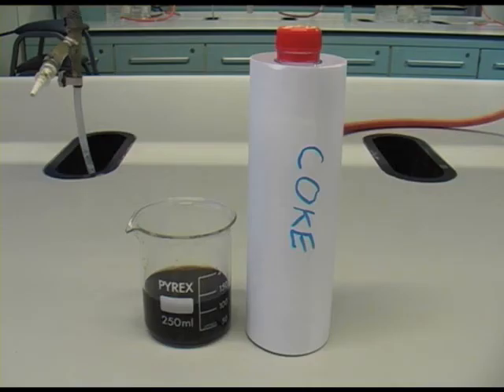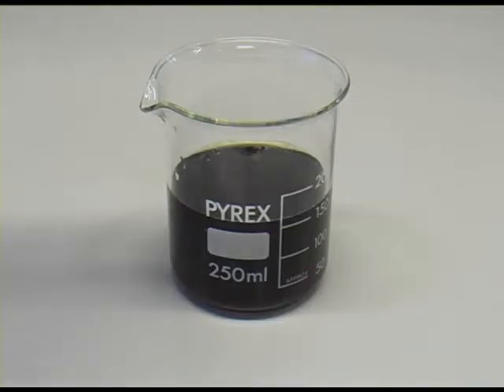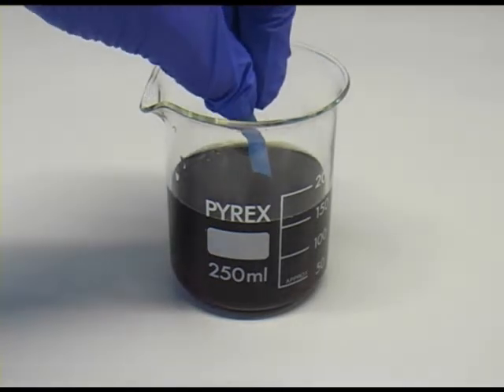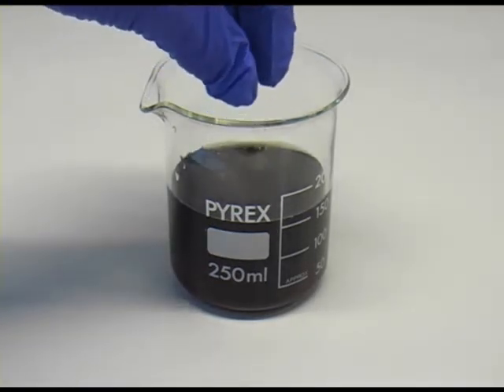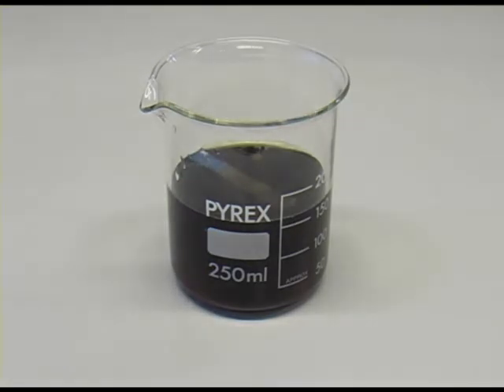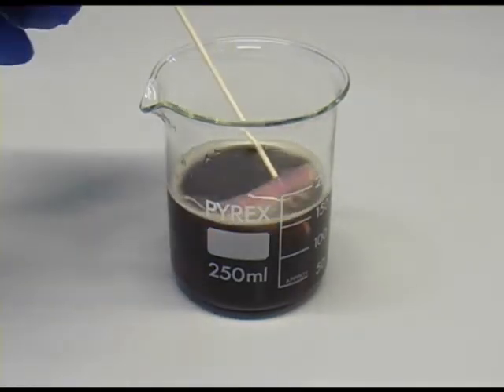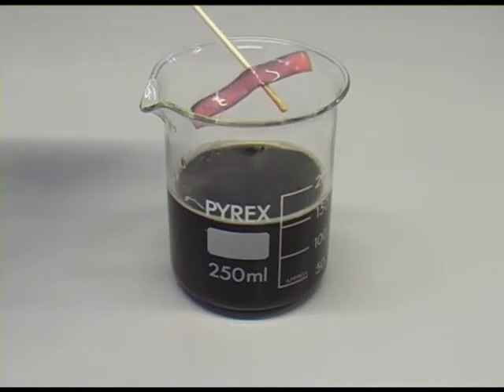Now let's look at some household substances. Here's some cola. Do you think it will be acid or alkali? Let's pop in some blue litmus paper. Give it a good stir. And you can see the blue litmus paper has turned red indicating that cola is an acid.